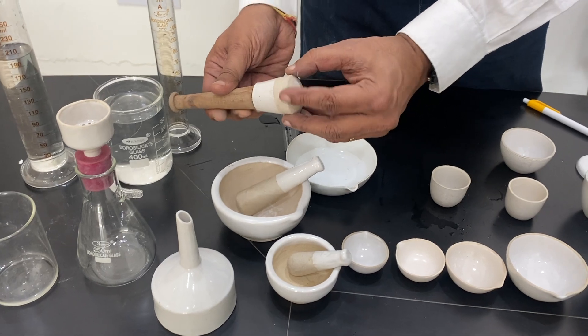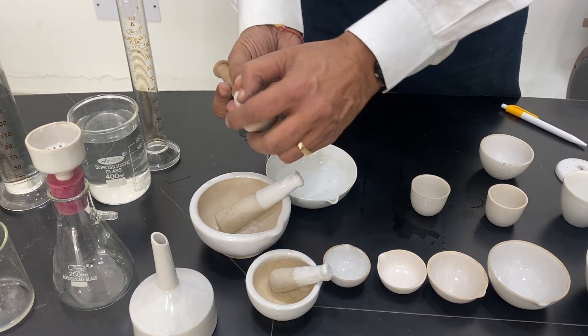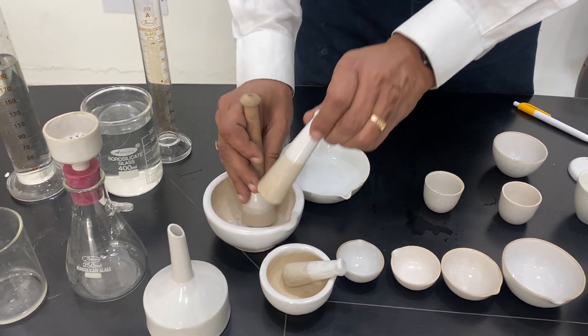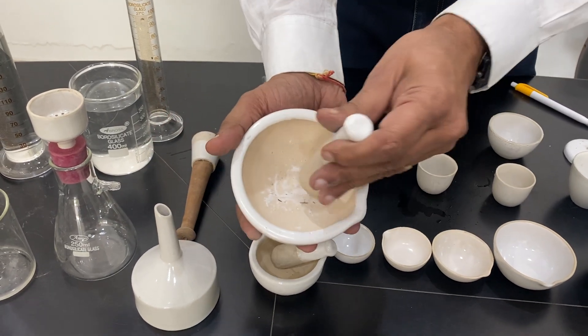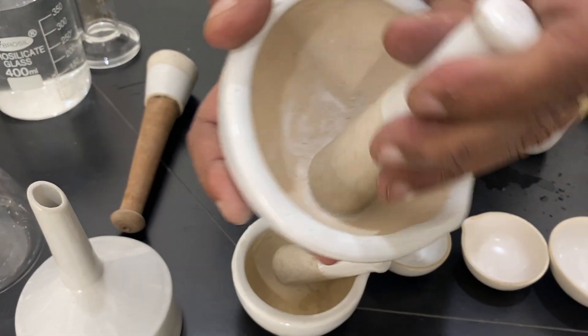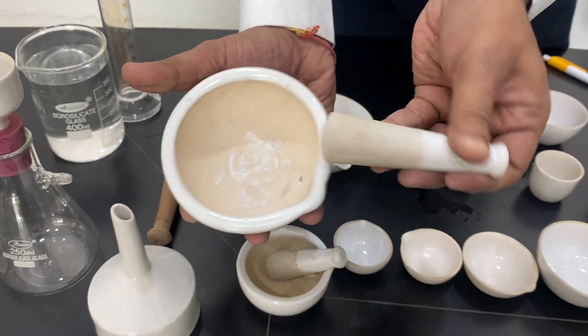All these have a surface which is rough, and to grind anything you can take a powder like a tablet, chemical, or solid product.